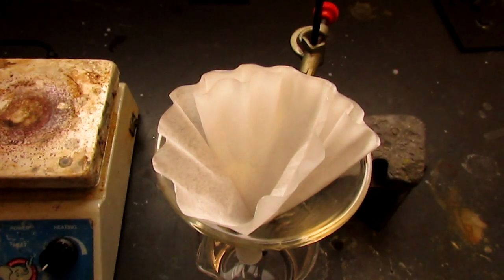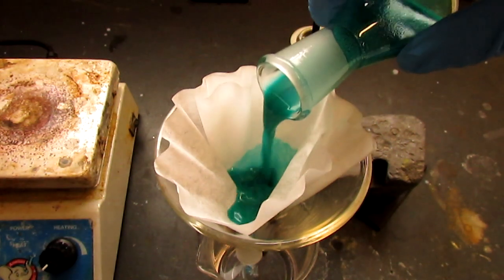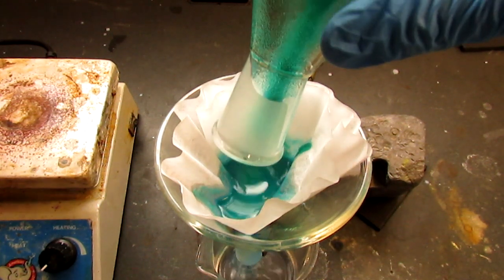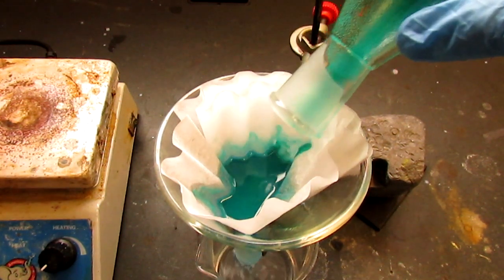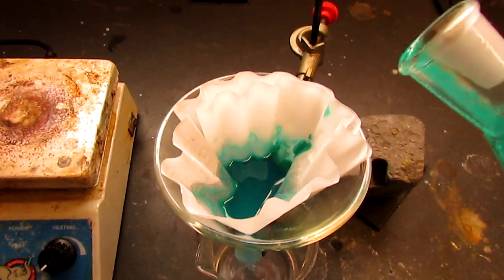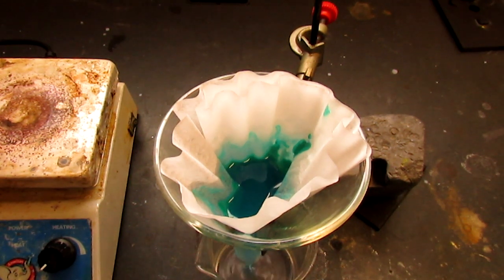The complex has been sitting, now it's cooled down, and now I'm going to filter it and wash it. I've adjusted the colors - they really don't look that good. It's a very green color. The camera doesn't do a good job of picking it up.